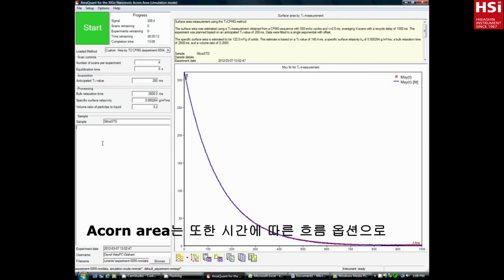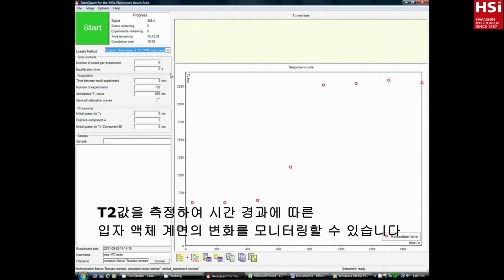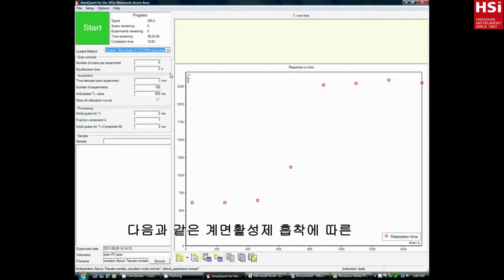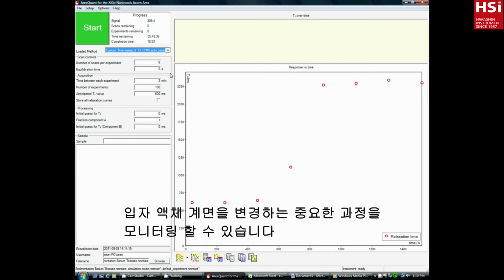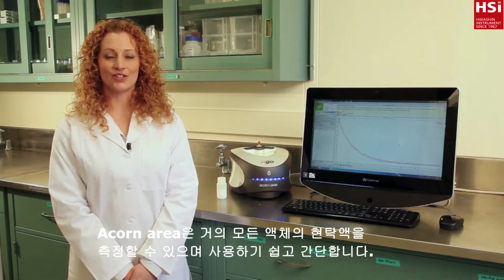The Acorn Area is also available to monitor change in the particle-liquid interface over time using the T2 as a function of time method. In conjunction with the flow-through option, you can monitor important processes that change the particle-liquid interface, such as surfactant adsorption. The Acorn Area can measure suspensions in virtually any liquid and is easy and simple to use.